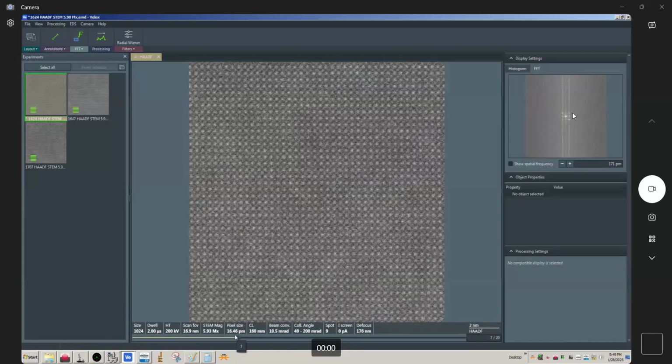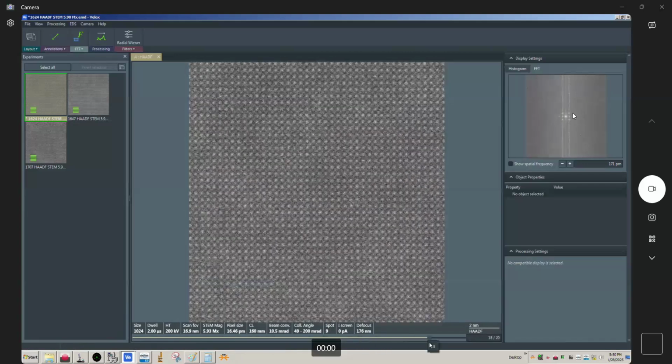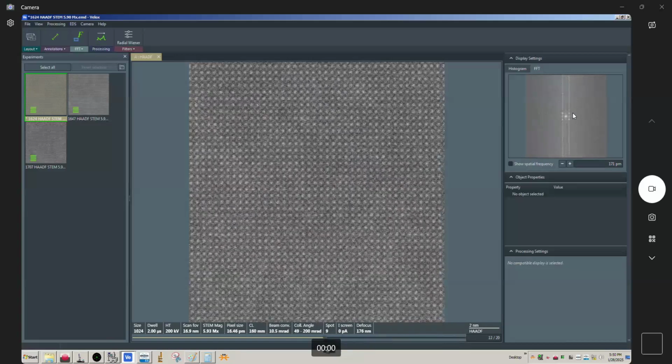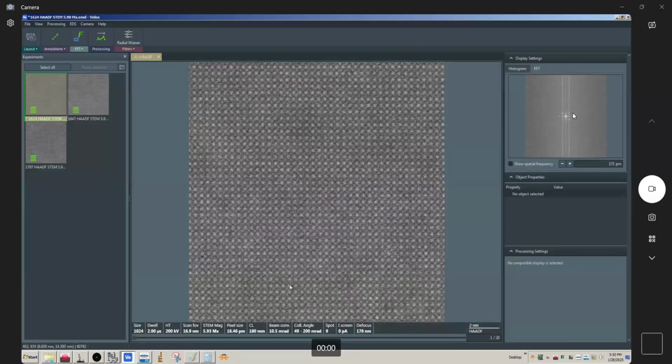You can see very clearly that my image is moving. My sample is moving, and it's actually moving in a quasi-chaotic manner, meaning it's not moving in a nice steady drift. So that's another problem that I've noticed: when the drift is not predictable or constant or stable, this also tends to have issues. And unfortunately in the Talos, we're in the room with the microscope, and that's probably the biggest reason why we see this kind of instability, even though I think the room met all the specs when the microscope was installed. But you can see very clearly as I'm cycling through this, the shifting between frames is not constant. We're not getting a constant drift in one direction here. But anyways, let's go ahead and do the DCFI.